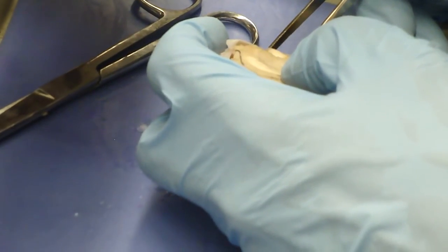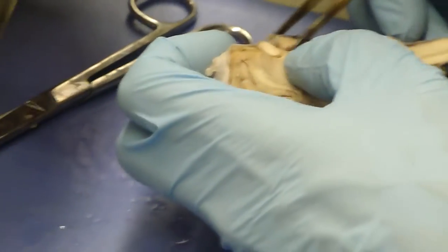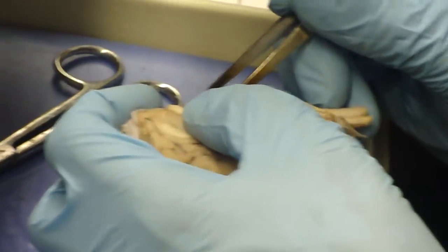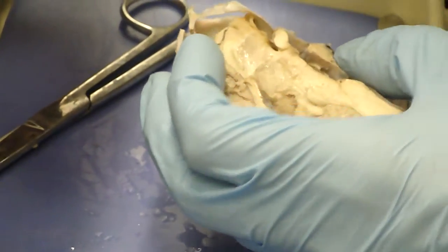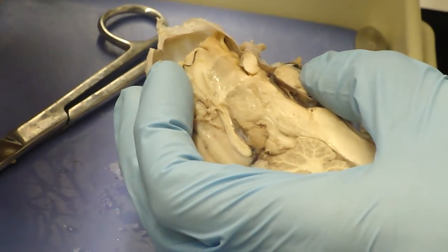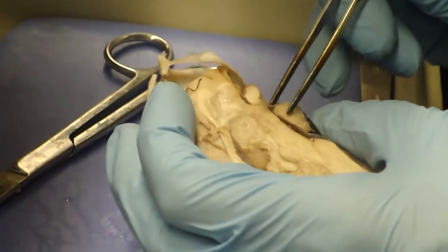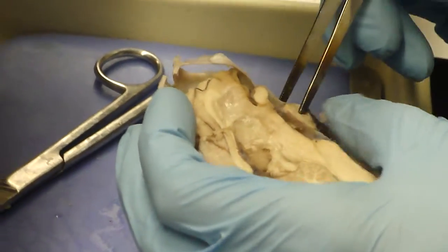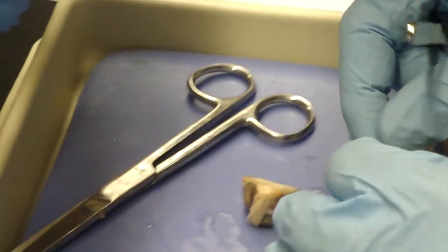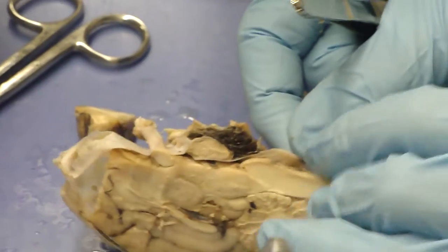What are they? In the diagram, I do not see something coming off straight like this. Oh, did I just rip it? No. This one is, let's see, coming off the side of the swollen area. Here's my swollen area. I'd say that this is oculomotor here. And I have no idea what that is. Maybe I should just rip it and it would go away. Can we do that on the practical? Imagine, just rip it and it'll go away.